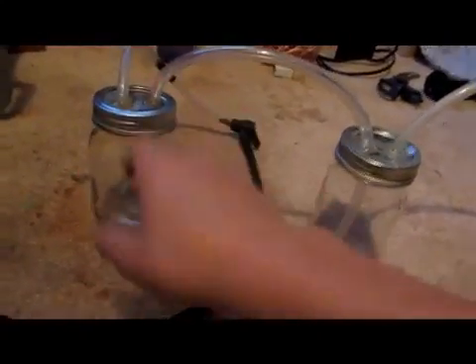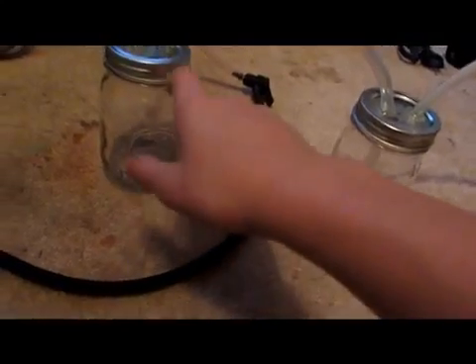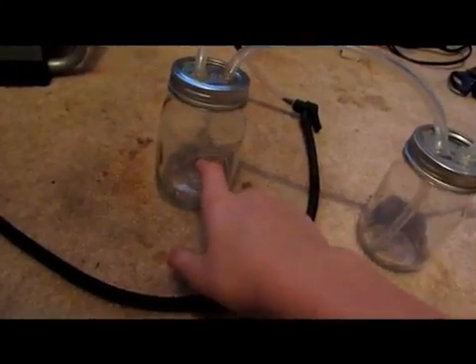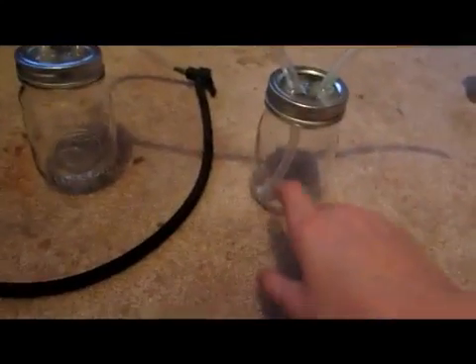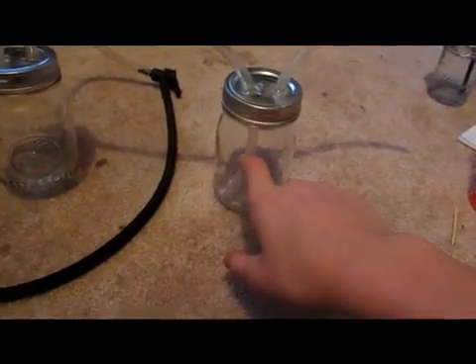This is a small compressor which gives out a steady flow of air. It's going to be blowing into here, pushing out the sulfur dioxide and supplying the sulfur with oxygen to burn into sulfur dioxide. Then it'll travel over here, bubble through the hydrogen peroxide, turn it into sulfuric acid, and then the other air comes out of there.